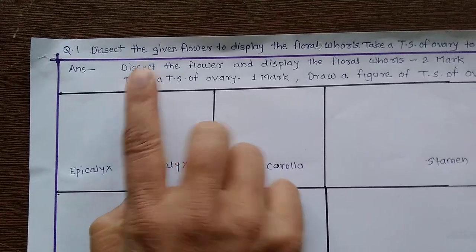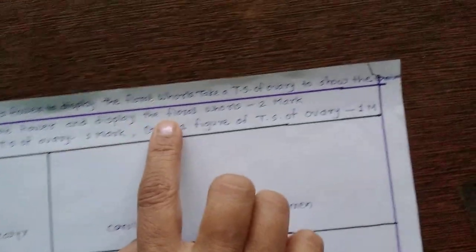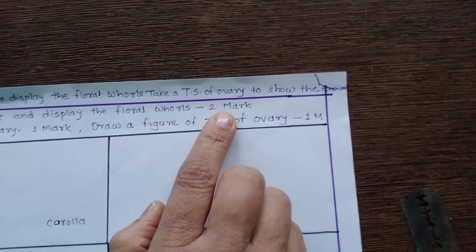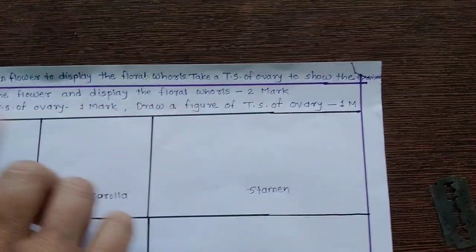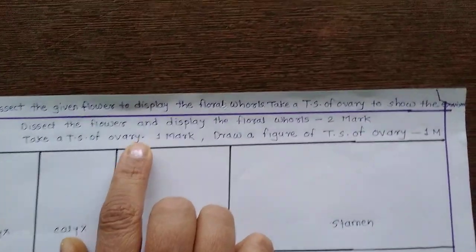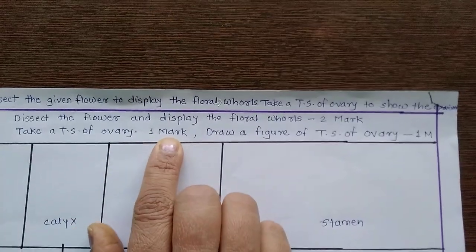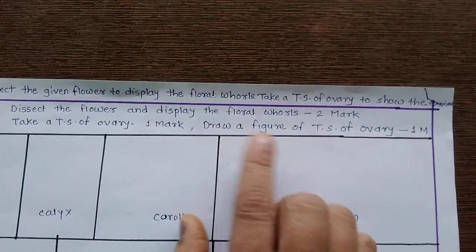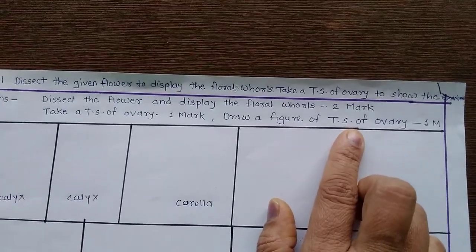In this practical, two marks are for dissecting the complete flower and displaying the floral whorls. For that you get two marks. Then take a TS of ovary and show to the examiner — that is for one mark — and draw a figure of TS of ovary, which is for one mark.